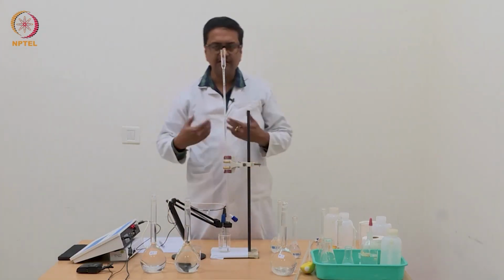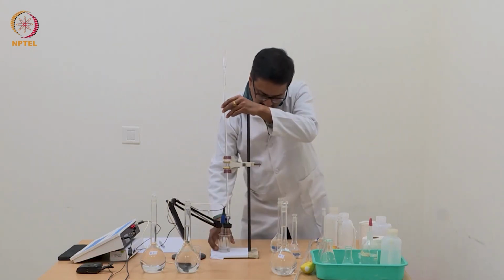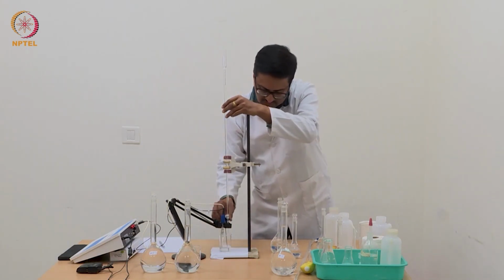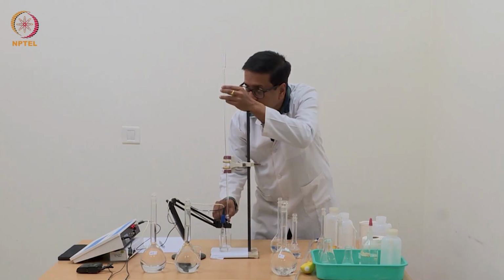So we should continue this addition as before, which we have already done for strong acid and strong base, and then for weak acid and strong base.